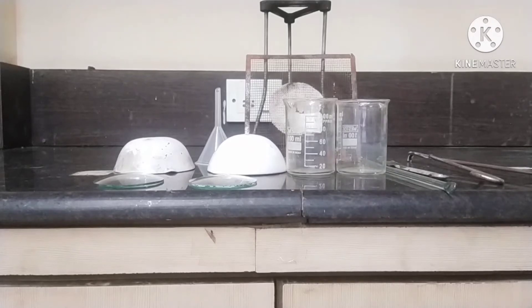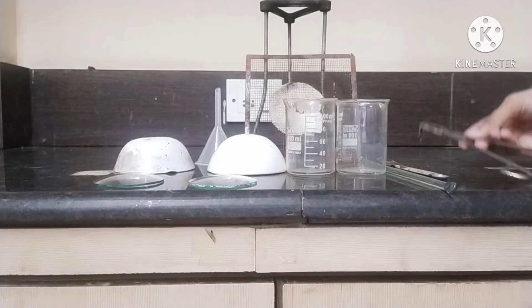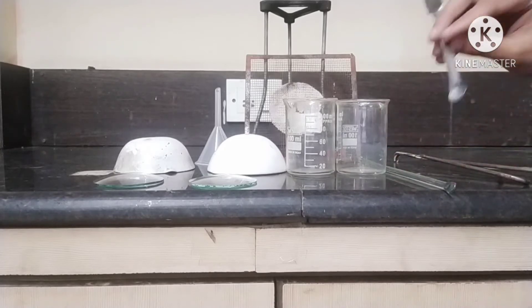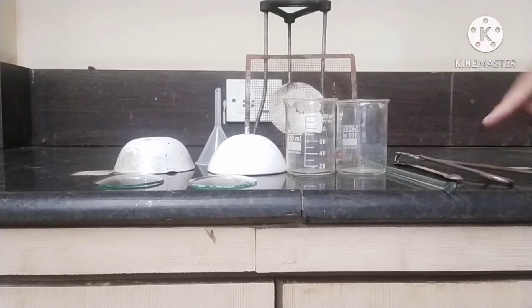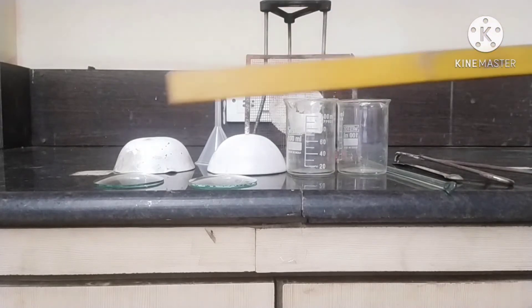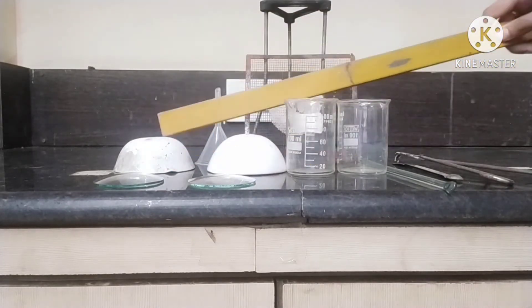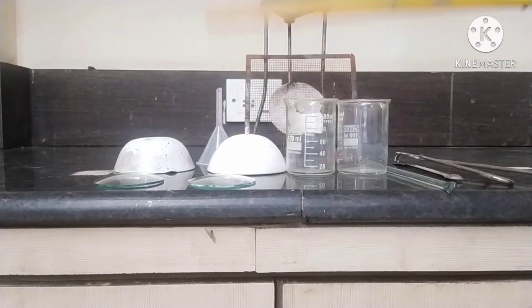Apparatus required in this experiment are: tongs, spatula, glass rod, pair of beakers, watch glass, china dish, funnel, tripod stand, and wire gauze.